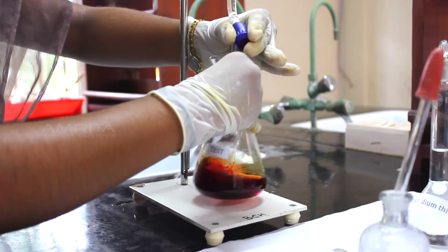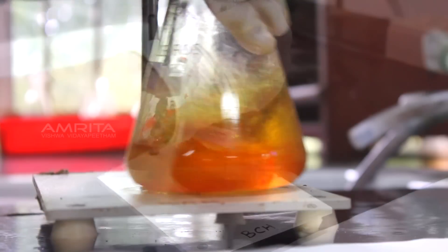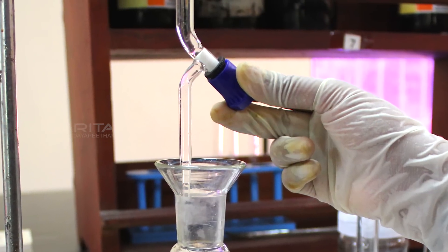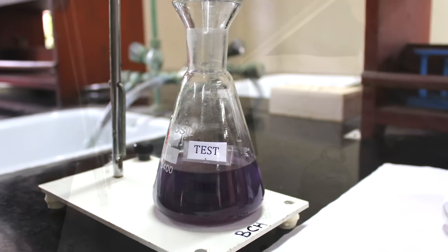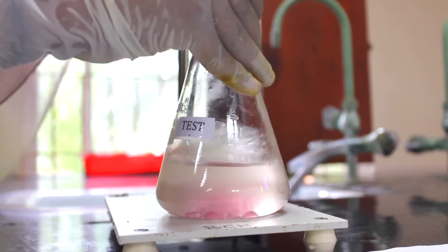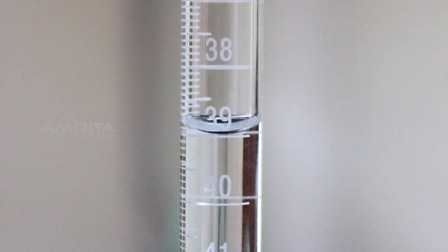Rinse the stopper of the flask with 30 ml distilled water and mix the contents again. The contents of the flask labelled test are then titrated against 0.1 normal sodium thiosulphate. Continue the titration till the solution turns pale straw colour. Now close the stopcock of the burette and add 1 ml of starch solution into the flask. The colour changes to purple-blue. Titration is continued until the colour turns colourless. The disappearance of the blue colour is recorded as the end point of titration.